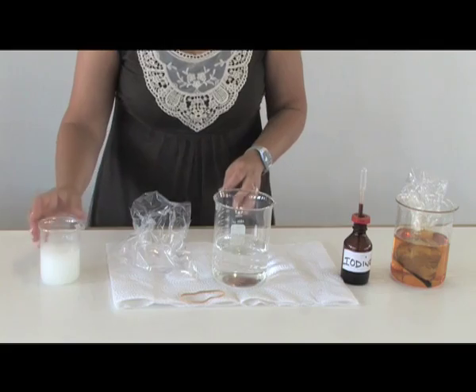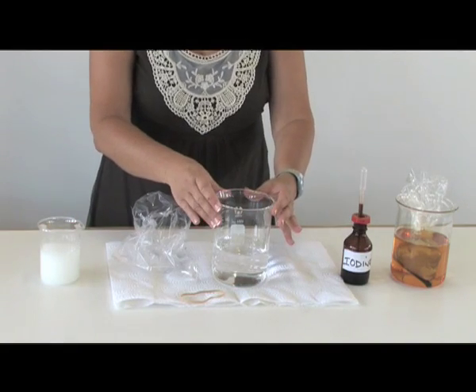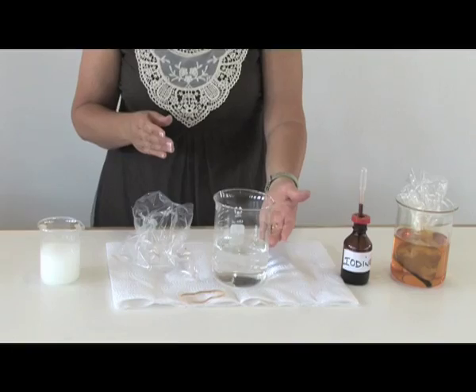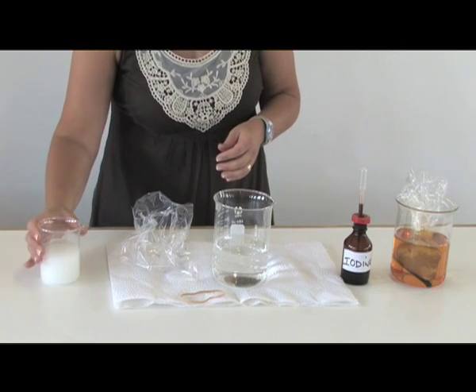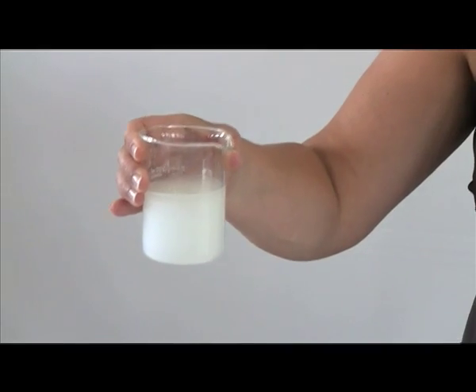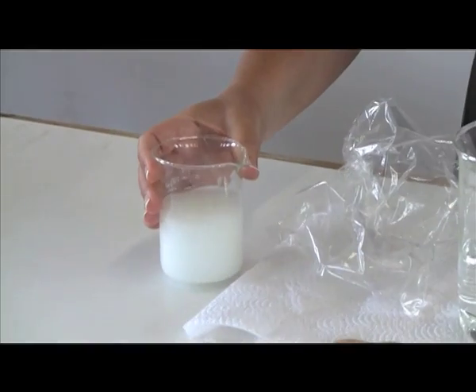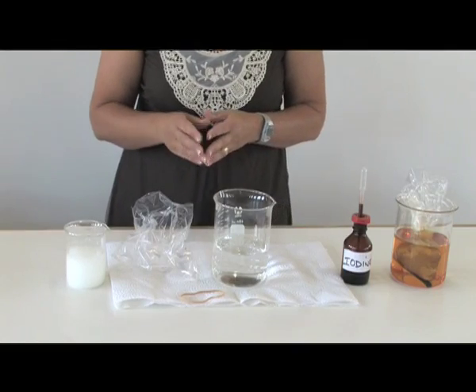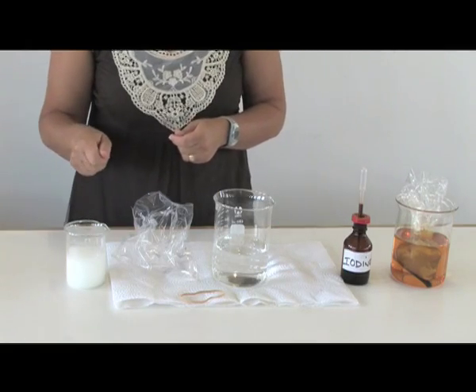We are going to take what we will need: a large beaker that is half filled with water. You would also need some cold water to mix and make a starch solution. You could use ordinary corn flour — maizena — and take about a teaspoon of it into a cup of cold water.